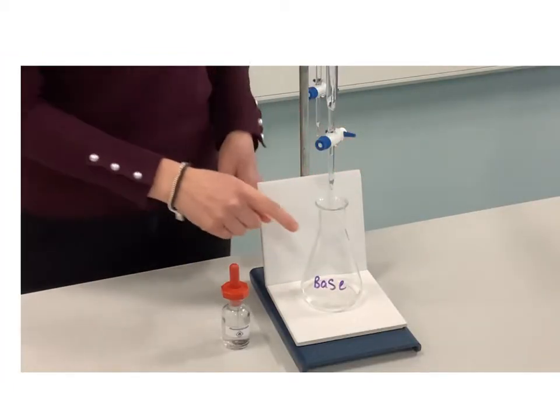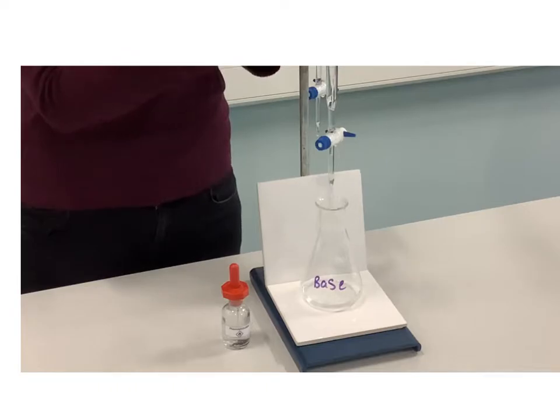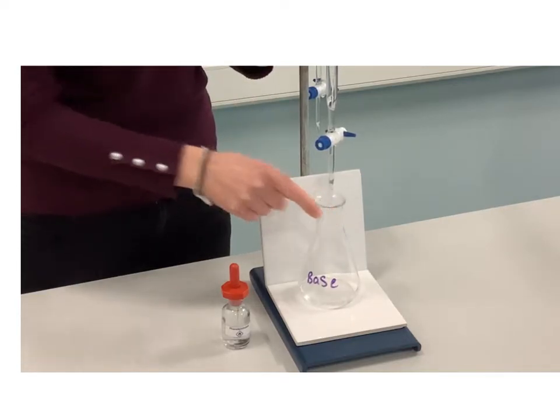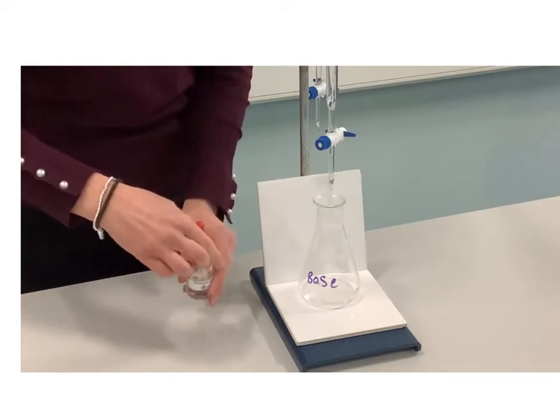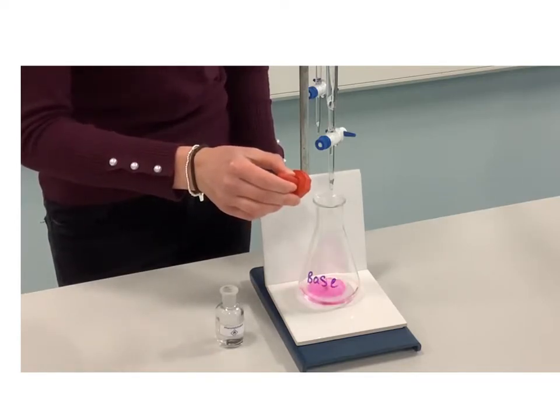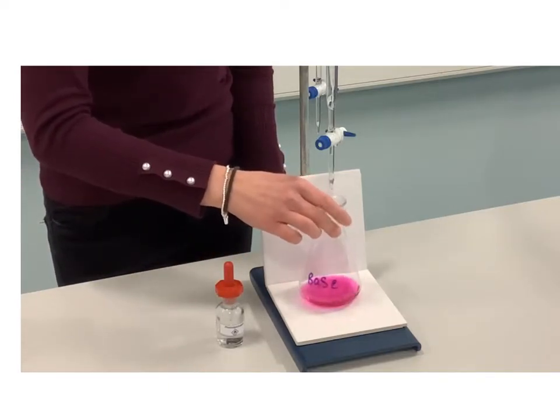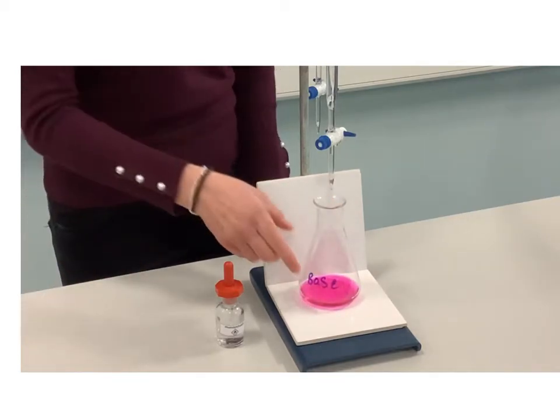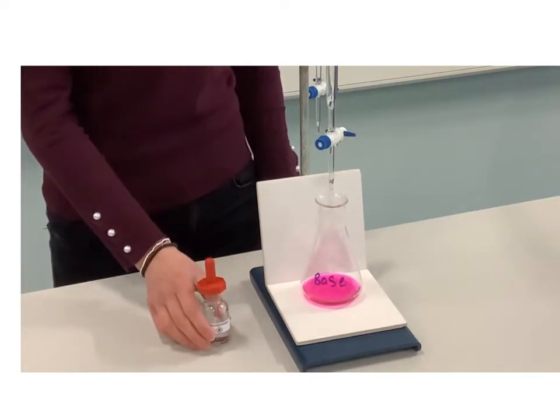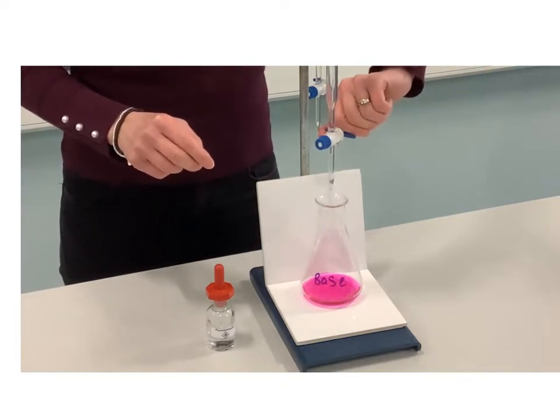I'm going to start by having sodium hydroxide in my conical flask, so I've rotated the burette clamp so that the burette containing acid is over the conical flask — I'm adding hydrochloric acid to my base, sodium hydroxide. I'm starting with the indicator phenolphthalein, adding just a few drops into the conical flask. The indicator is always added to the conical flask. We have sodium hydroxide, which is a base or alkali, in our conical flask, and phenolphthalein is pink in alkali, so our starting color is pink.